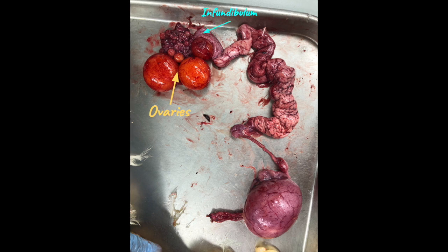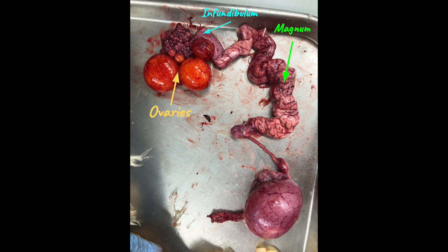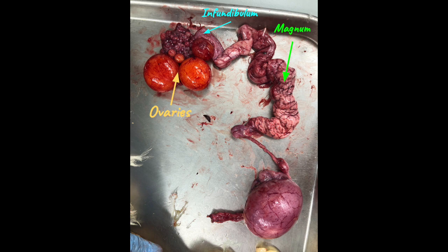On the way to the infundibulum, sperm is stored. The oocyte is caught through the infundibulum, and we then go to the magnum — this is where proteins are made, such as albumin. The wall is thick with all these glands that contribute to the egg.